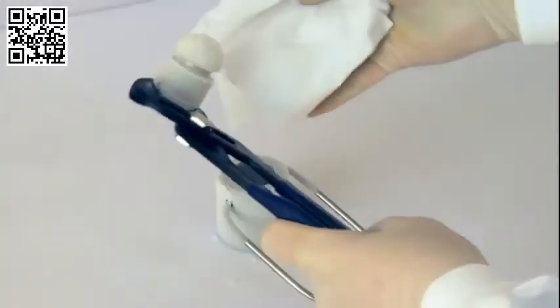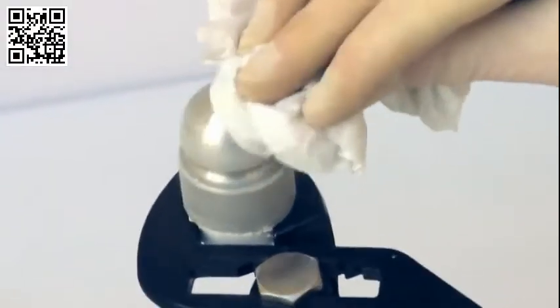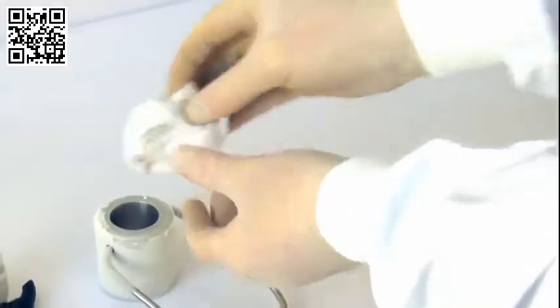The Cell Crusher can be cleaned at low temperatures without water. The handling pliers allow a firm grip on the piston, while the chamber is cleaned with the aid of the recovery spoon.